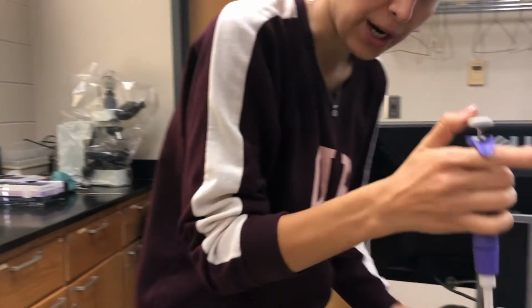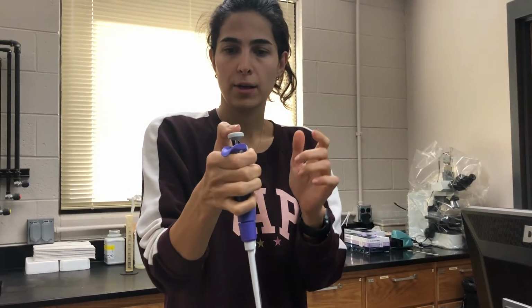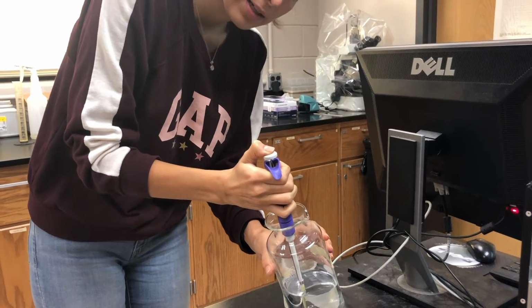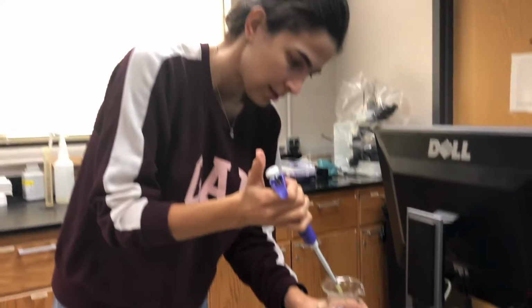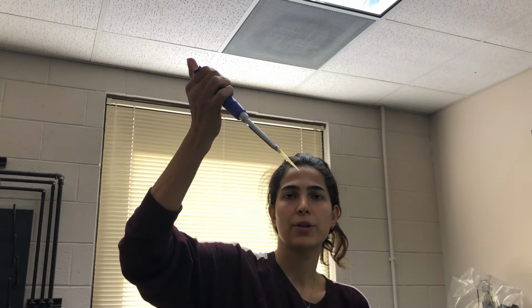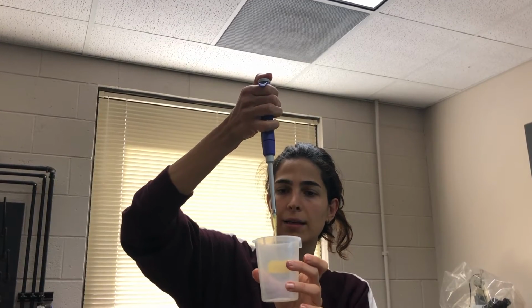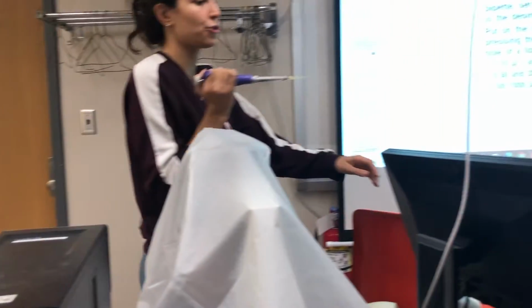I will go one more time. No volume, nothing. Go to the first push, submerge it to the liquid, then release the push. You grab the 45 microliter, again push the button and release it, okay? Something that you should know.